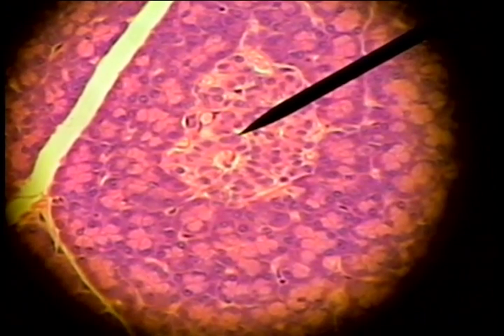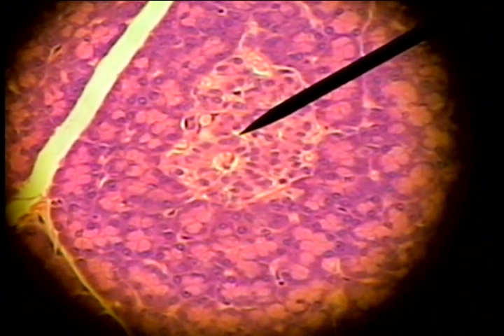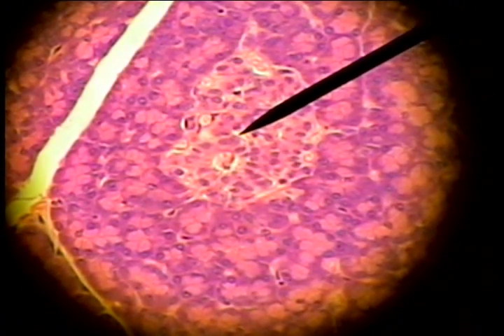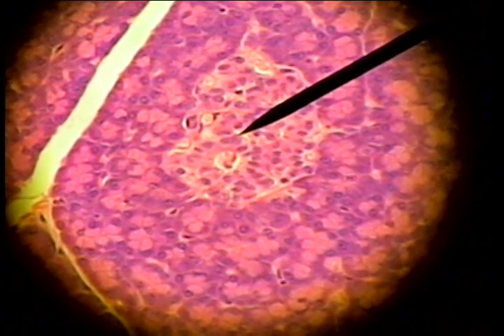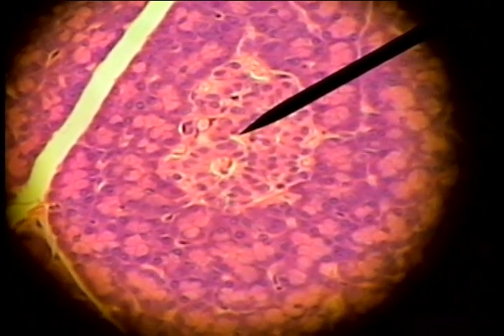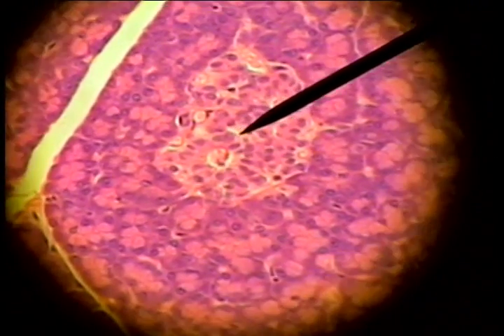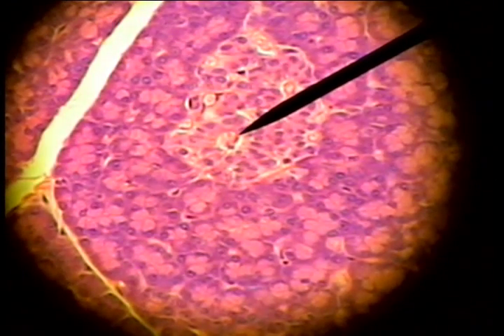It has these capillary or vascular sinusoids that will receive the endocrine signal molecules from the cells of the islet of Langerhans.